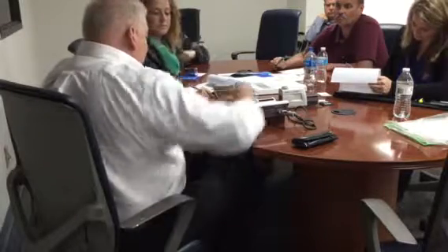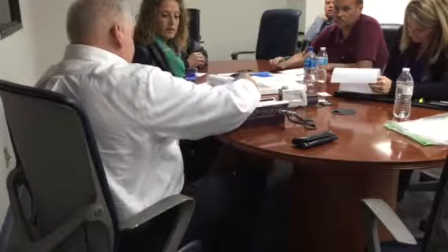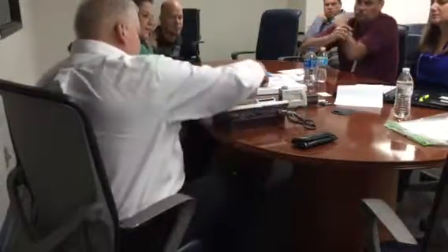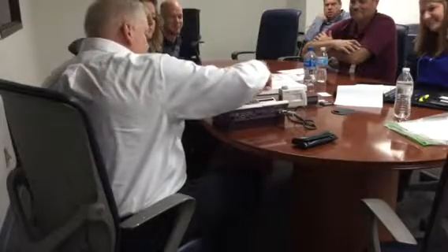All right, so now we take a look at this top bar again. Auto range, ISO, 0.5 millimeter per second, 0.8 times 5, our nominal value. We ask everybody to get off the table, and go ahead and get started. If you watch here, right now it's 3 micron, now it's 15, now it's 30. So the window is opening to get the data in.